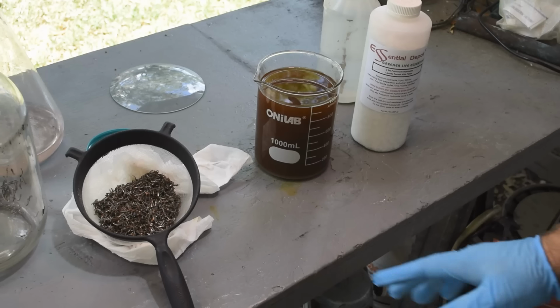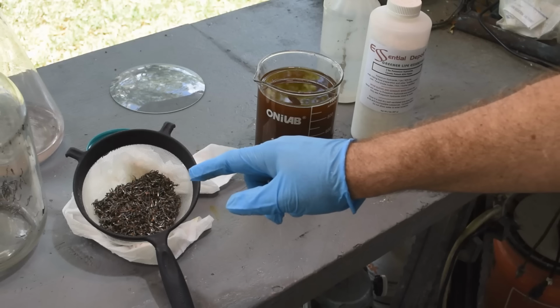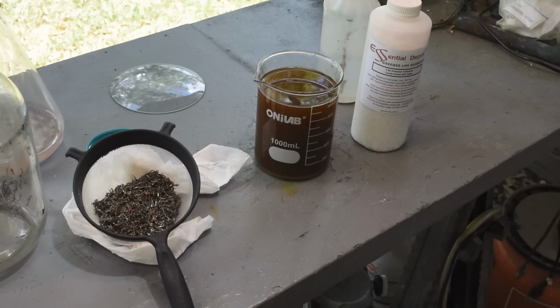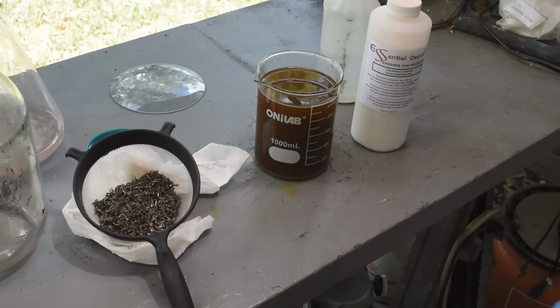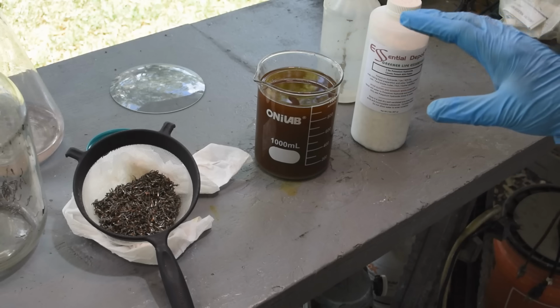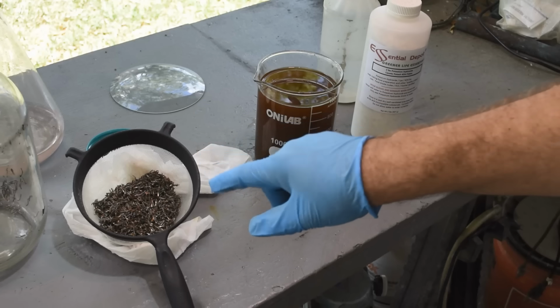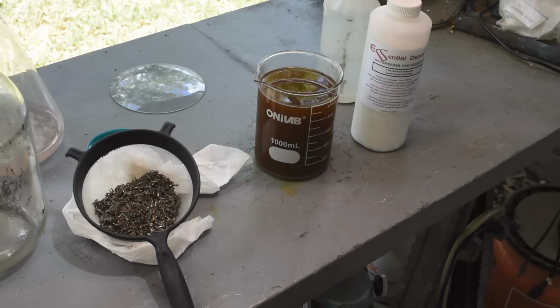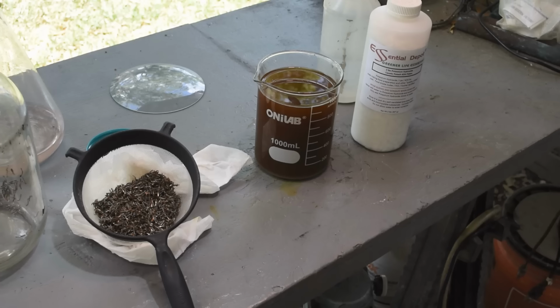So, all right, here's what I'm going to do. I'm going to store these with other pins I've used the iodine leach on that still look like they have some gold on them. So we may revisit these pins and see if we can get the rest of the gold off of them in the future. Clearly, I need to do this experiment a second time and remember to clean the pins first. So we will do that. But let's see how much gold we recovered from the dirty pins.